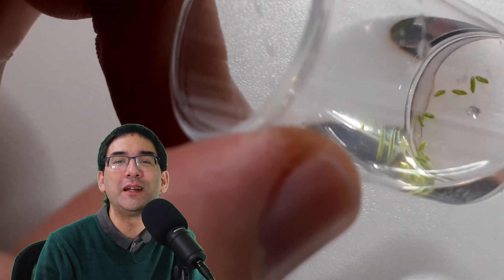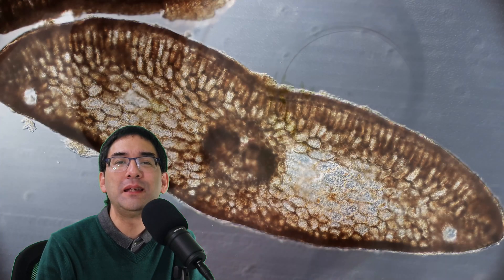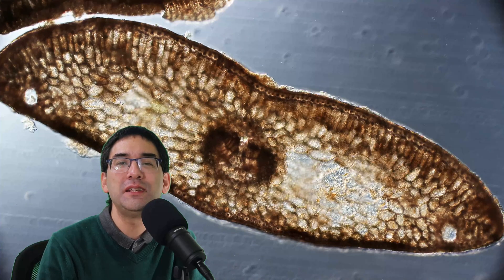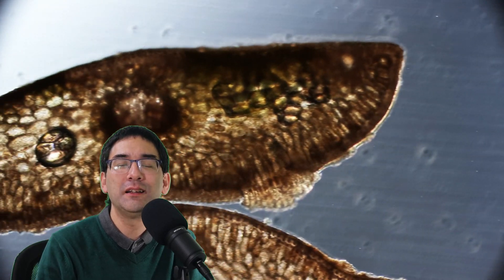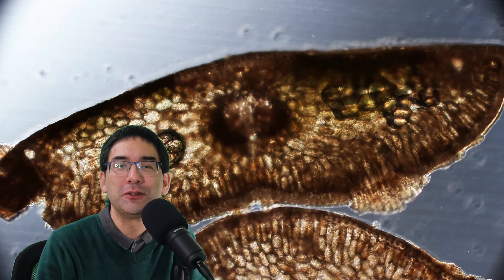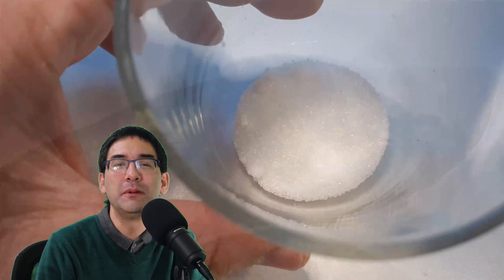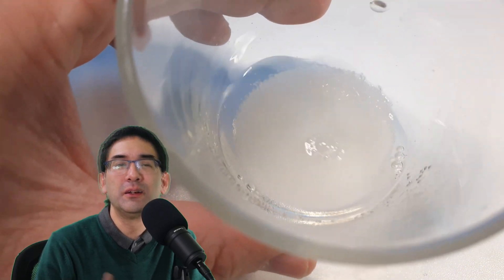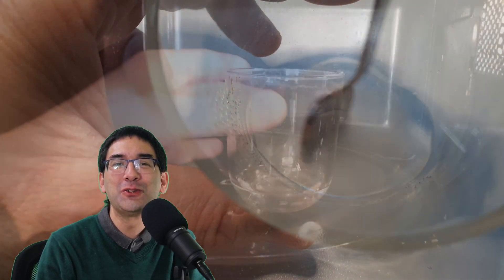A little bit of concentrated alcohol does the trick. After approximately 10 minutes I could see that much of the chlorophyll was removed already and everything was significantly brighter. Of course everything was also colorless — well, what do you expect when all the chlorophyll is gone? So I tried a different method.